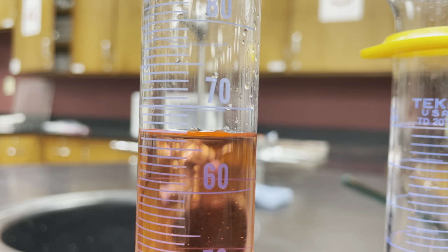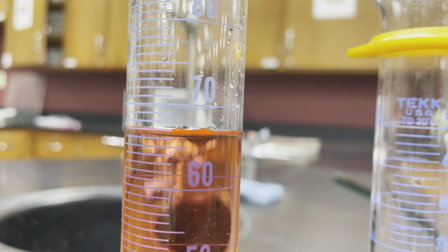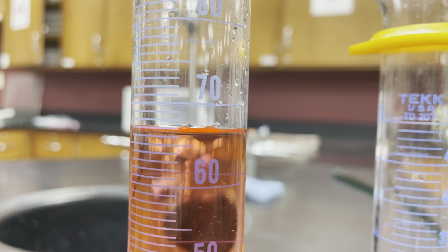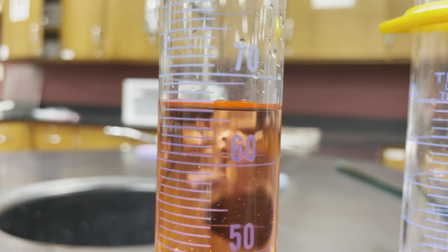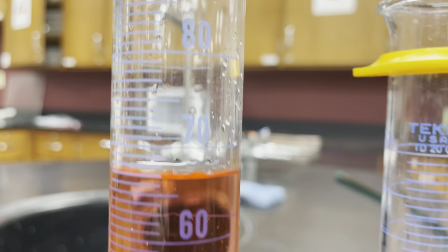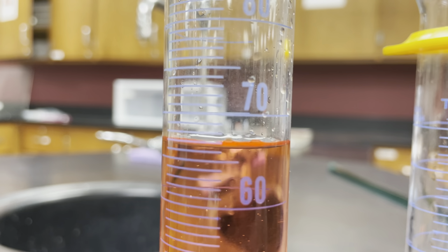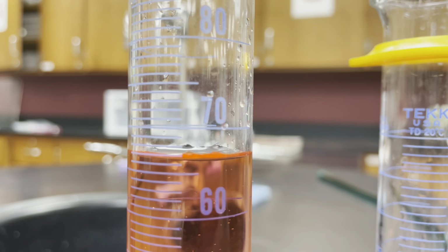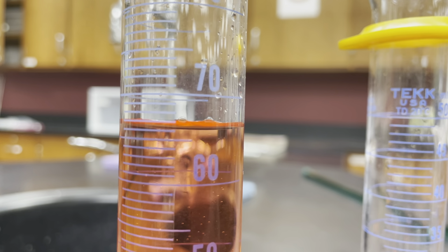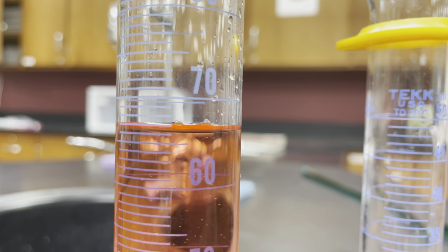All right, so what we're reading here is there's lines between 60 and 70 that look like there's 10 of them. So it goes from 60 to 61, 62, 63, 64, 65, 66, 67, 68, 69, 70. So each of these little lines in between 60 and 70 counts as one, where 60 is sitting on that line and 70 is sitting on that line. So I know for sure that my measurement is above 65 and even above 66 milliliters. And then from there it gets a little foggy, whether it's right on 67 or a little bit below. But I know for sure where 66 and 67 are, and it looks like my meniscus, the lower part of that curve of the liquid, is between those two.